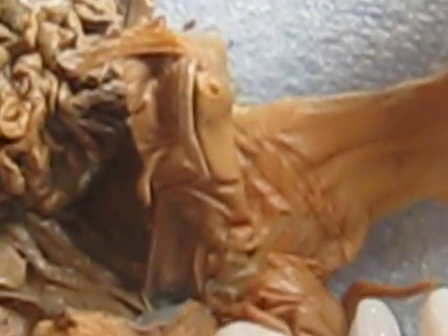Now also this is a male pig. Right here is his urogenital opening, and he did not have the urogenital papilla. So this is a male. Here was his scrotum sac right here, and there's one of the testes right over here.